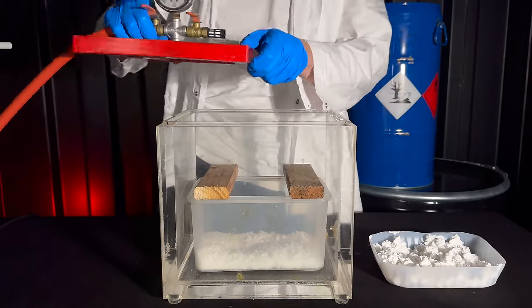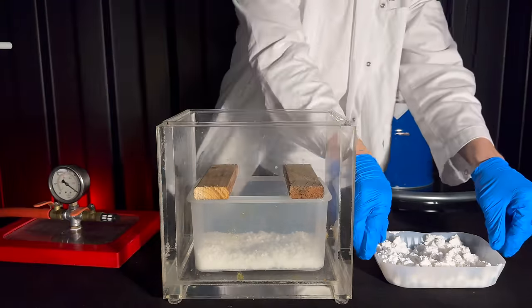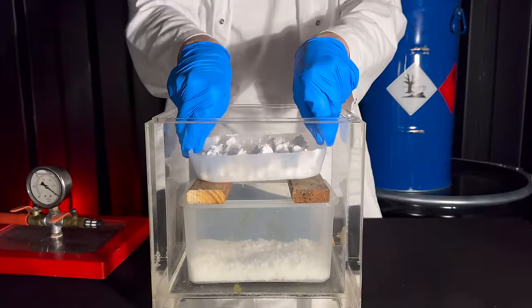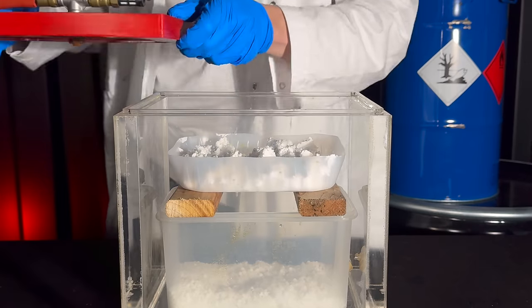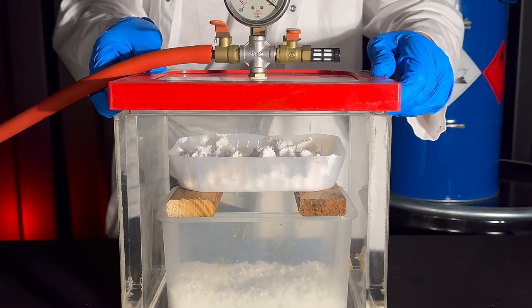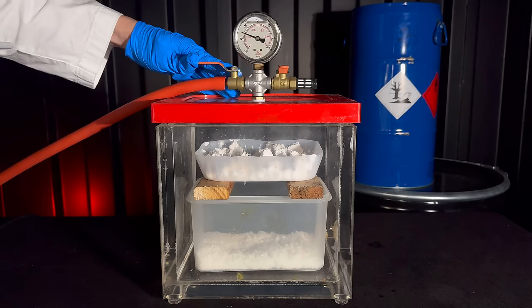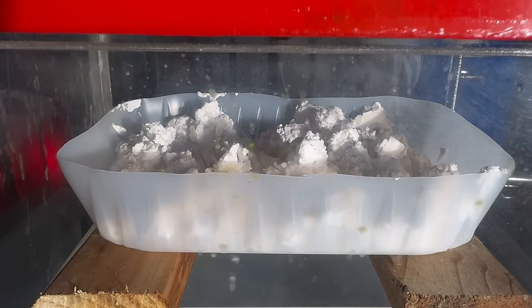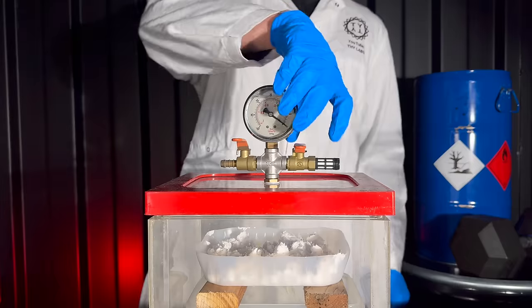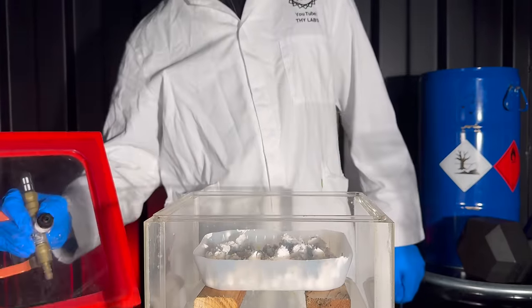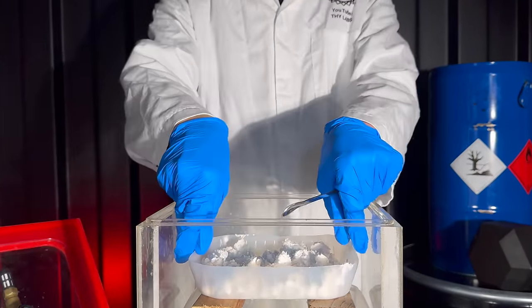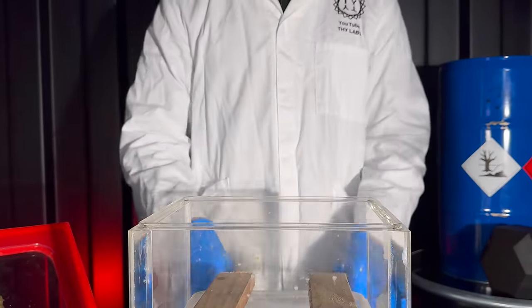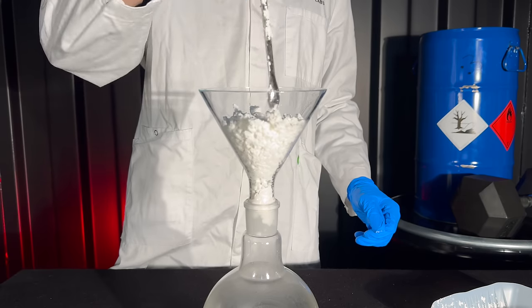For removing the water, I decided to put the plastic tray into a vacuum chamber over anhydrous calcium chloride. My vacuum pump ended up breaking and as the chamber is not perfectly airtight, it filled back up within a day. I also did not want to wait weeks for it to dry, so it will be used while wet for the next step.